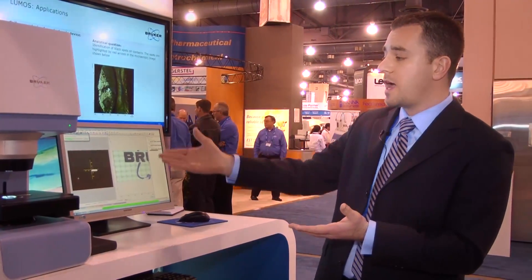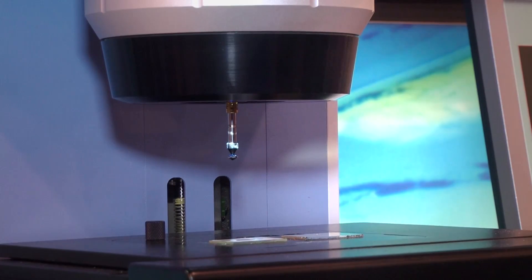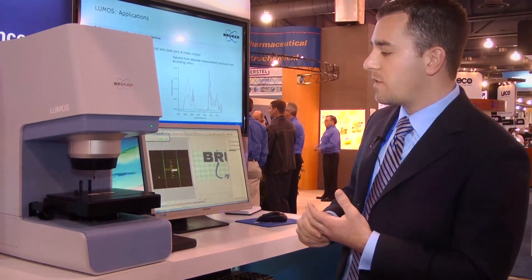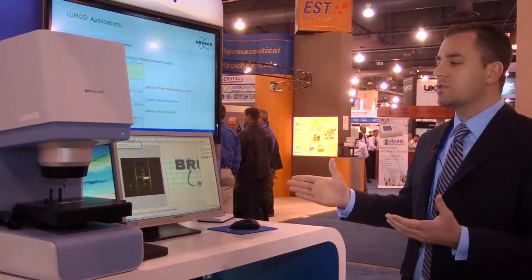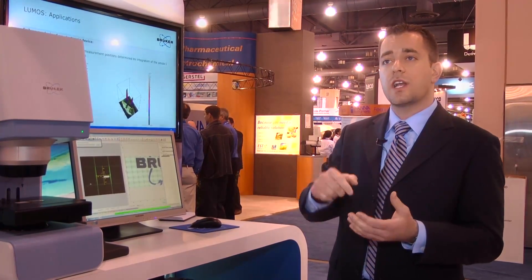When I go to take my background, the stage lowers automatically. One of the biggest unique features of the Lumos is the automated ATR. That ATR objective is just like an anvil — the spot is about 100 microns in diameter. The infrared beam clips it and we take our background completely automated. Even the aperture blades are automated, so whether you aperture down to 10x10, 20x20, or even 5x5 microns, the aperture blades set themselves based on the aperture area you defined.